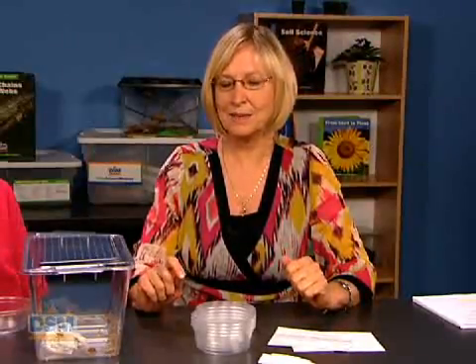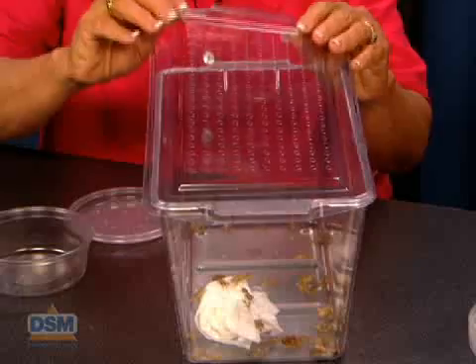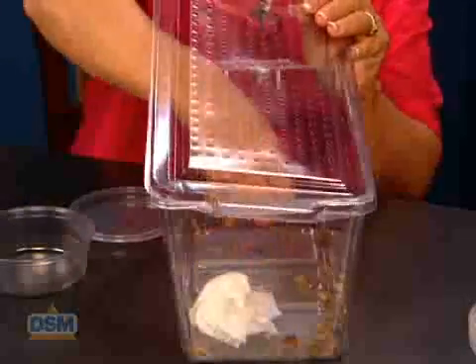Cut sheets of construction paper into 5 by 5 centimeter squares so that each team of 2 will have a square. Place 2 crickets in each of the 16 plastic containers and carefully cover the containers with lids. We want to be sure to show our living organisms respect. That is one of our National Science Education standards. So, Johanna, why don't you take those 2 and put them in there?